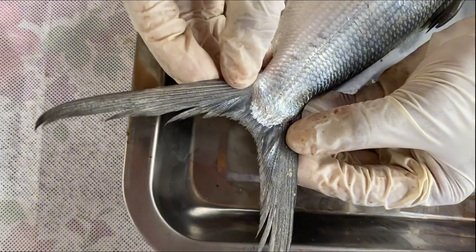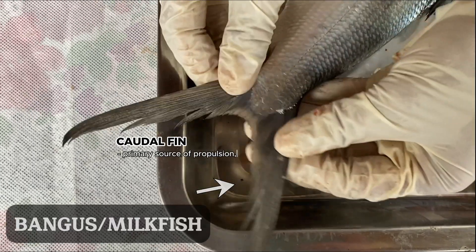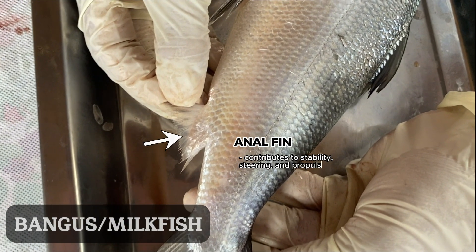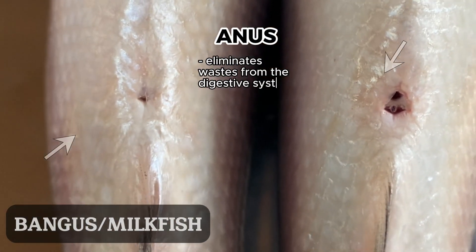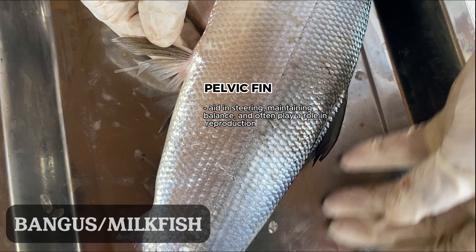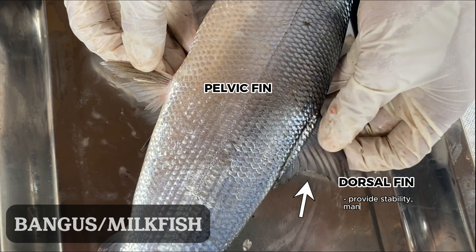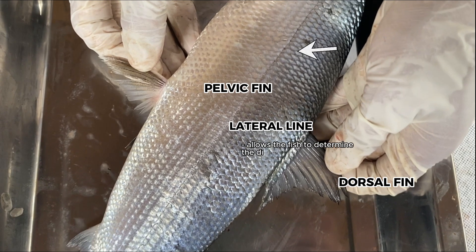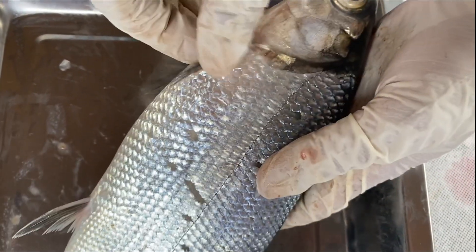Caudal fin: it is a primary source of propulsion and facilitates speed and direction control. Anal fin: it contributes to stability, steering, and propulsion in certain species. Anus: it eliminates waste from the digestive system. Pelvic fins: they aid in steering, maintaining balance, and often play a role in reproduction. Dorsal fins: they provide stability, maneuverability, and serve as a defense mechanism. Lateral line: this allows the fish to determine the direction and rate of water movement.